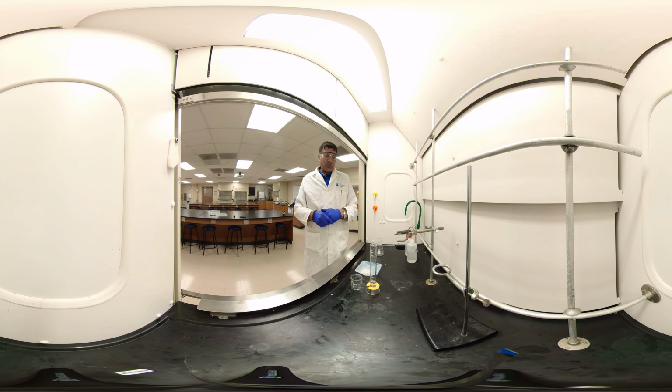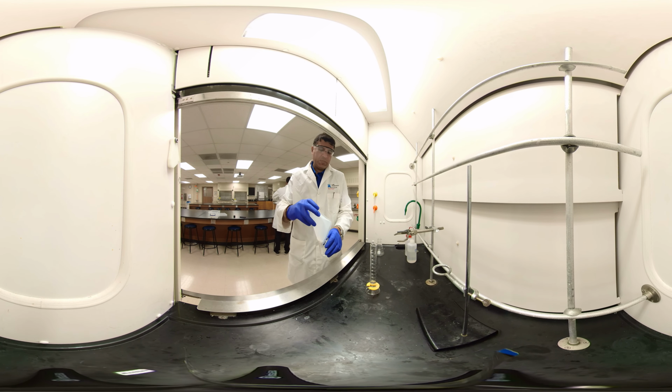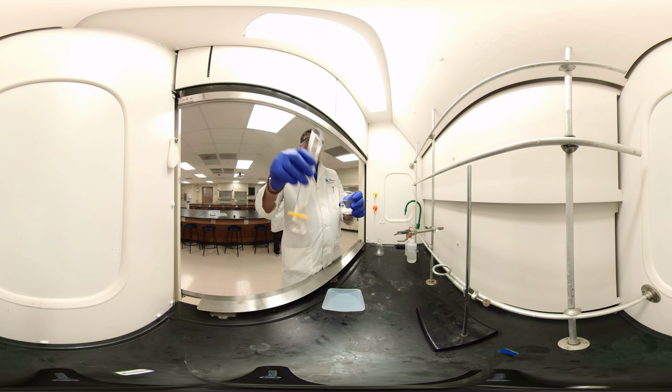Today we are going to perform the experiment on disproportionation of benzaldehyde. So what do we need? We're going to react. We'll take the sodium hydroxide. It's 18 gram, okay? 18 gram in this much. And I have 18 milliliter deionized water.